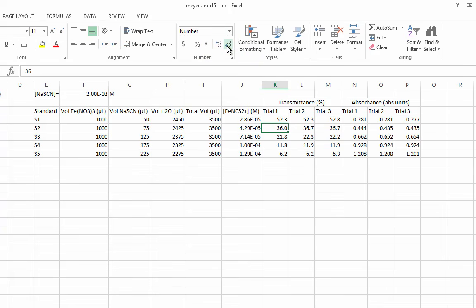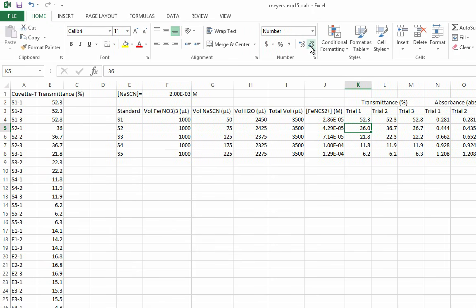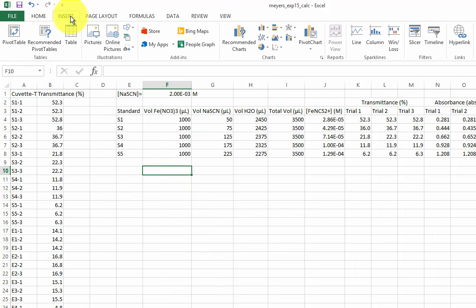Okay, we have all the data we need for the standard solutions so that we can create our calibration curve, or Beer's law plot. In this course, you will most likely only use scatter plots. In the Insert tab of the ribbon, click on the Scatter Plot dropdown. There are a few styles to choose from.